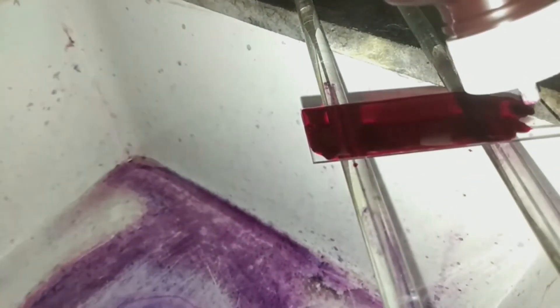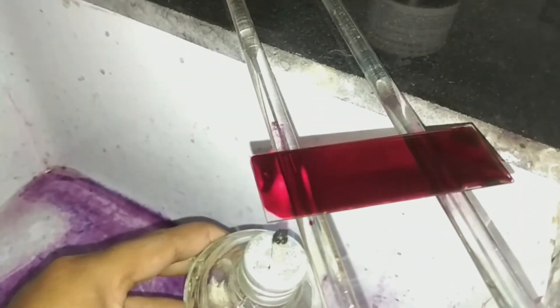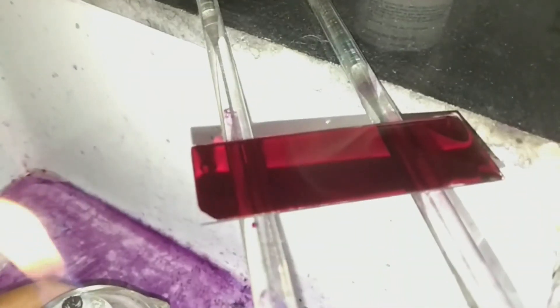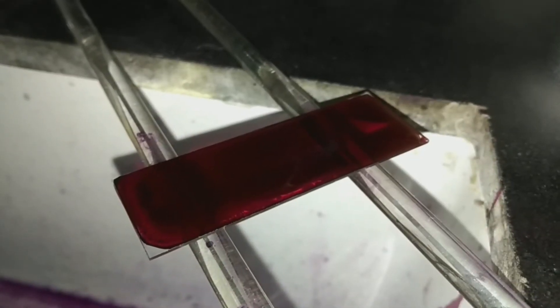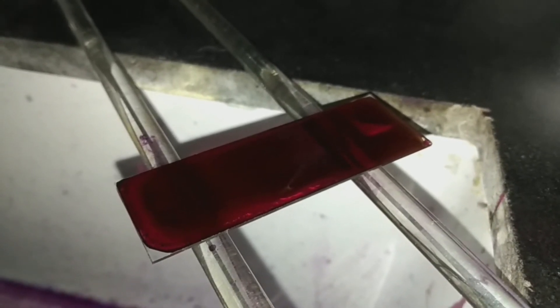After flooding with carbol fuchsin, perform the important step of heating the slide from the bottom until fumes appear. This is done for five minutes in an intermittent manner so that the slide does not boil — as you can see, fumes are arising. After heating, place the slide in an idle condition without heating for another five minutes.